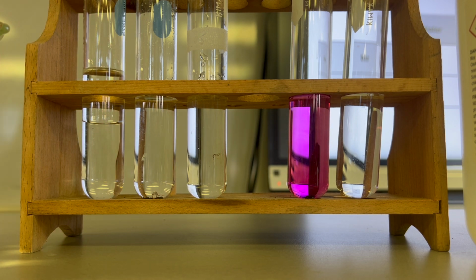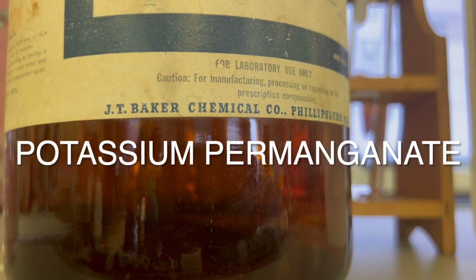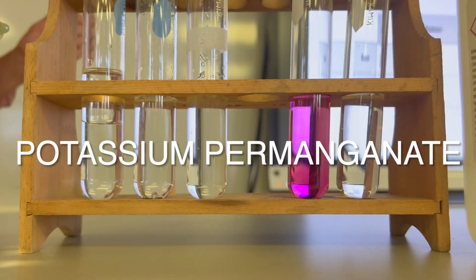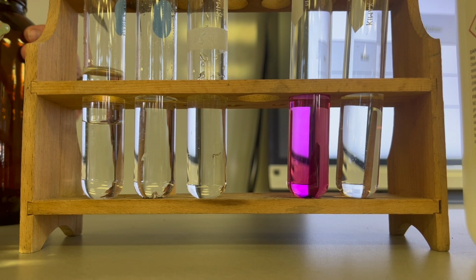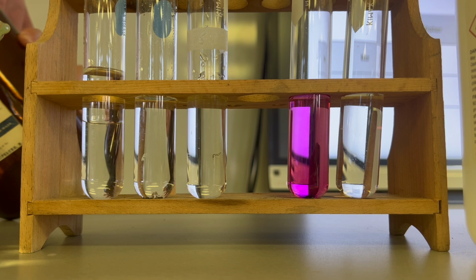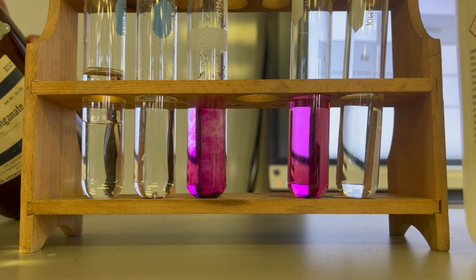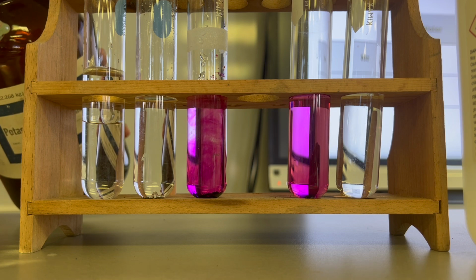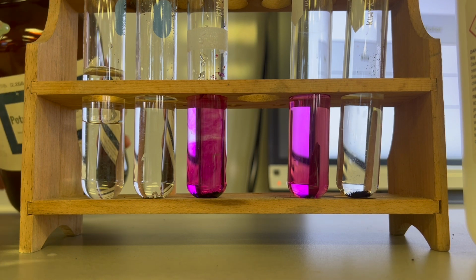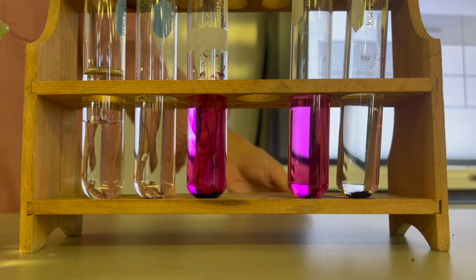Let's go now to the potassium permanganate. This is this giant bottle here. I'm going to put it first in the water, and then I'll do the same thing and put it into the hexane. Here is potassium permanganate in water. And here is potassium permanganate in hexane. We got the direct opposite happen.